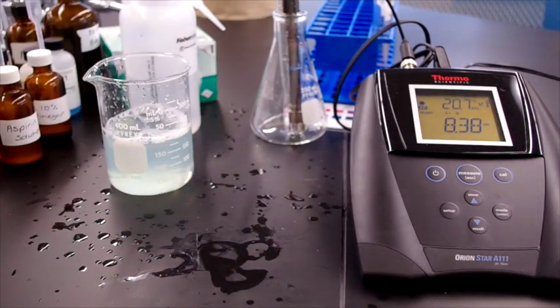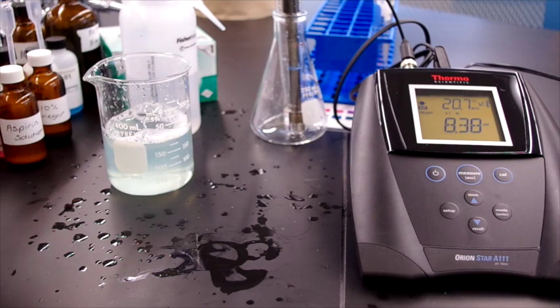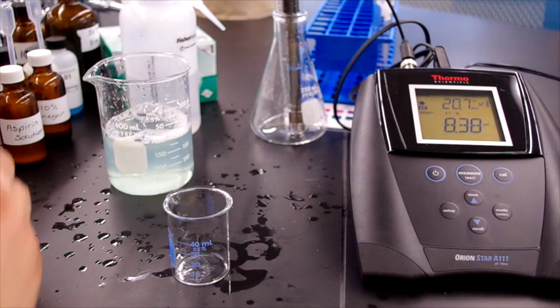Pour our waste, and then we do our ammonia solution.